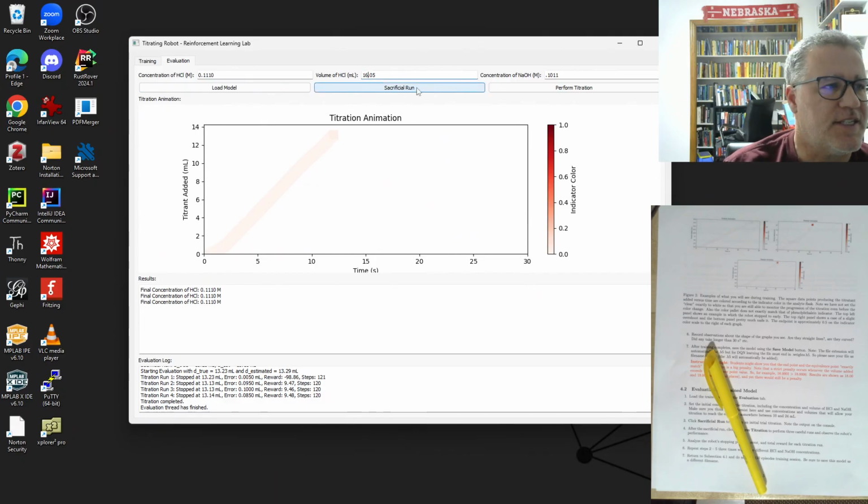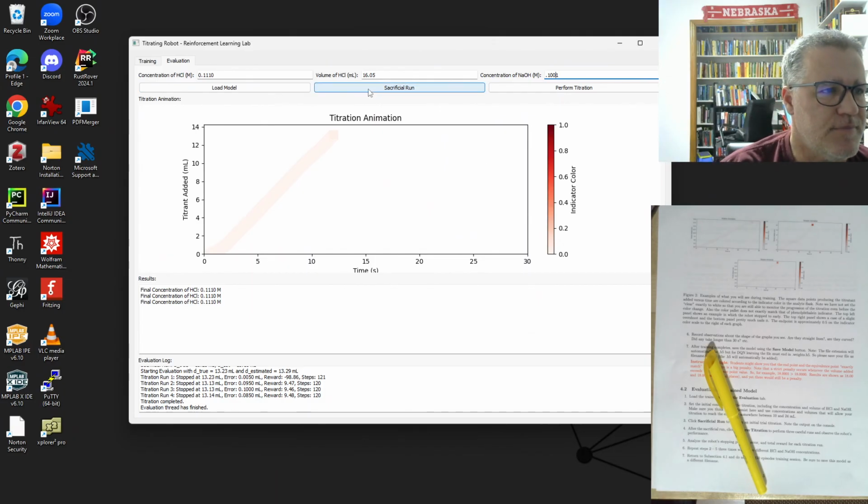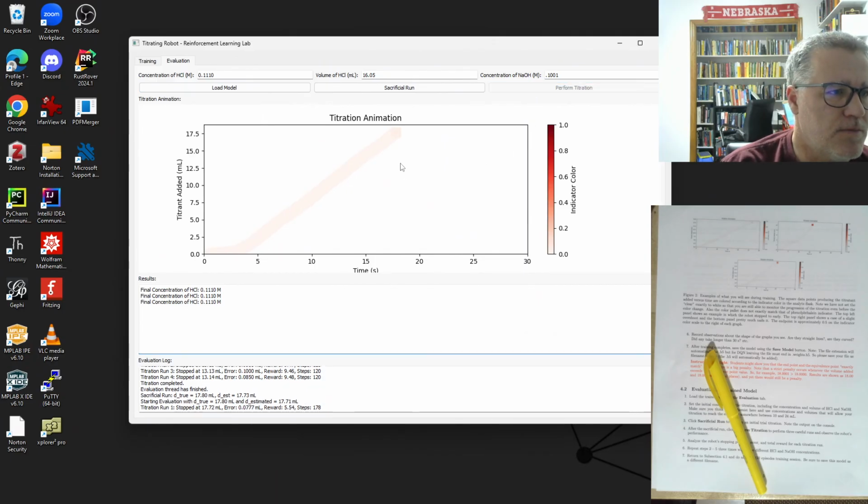Let's go back to that 16 and change this again. And you want to stay reasonably close to 0.1, and you want your endpoint to be somewhere between 10 and 25. Okay. And so, close, but we did have one run that went past.